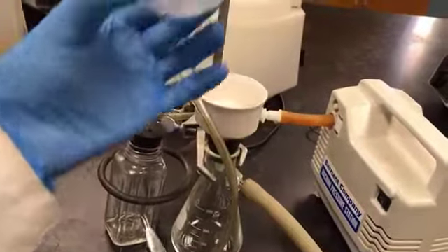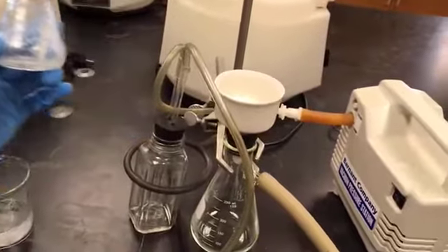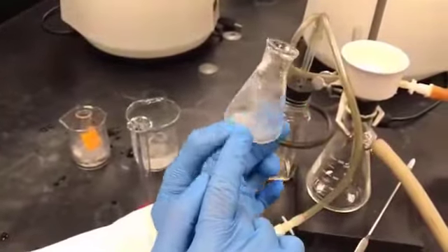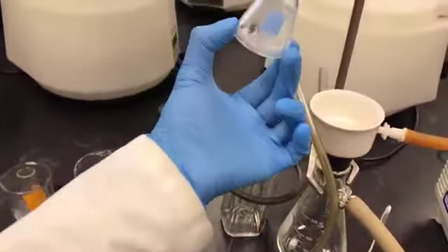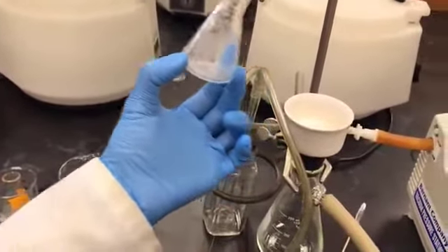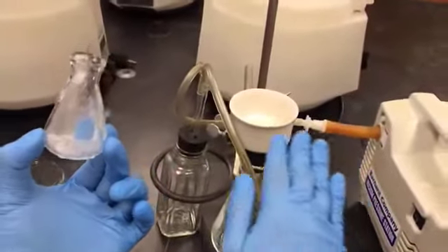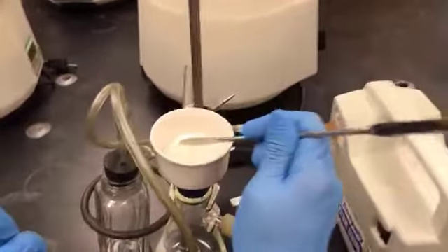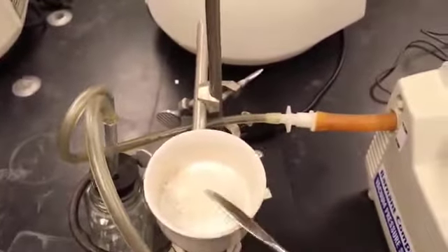Now you can see the crystals are still here, right? So what I will do is take 2 milliliters of the chilled ethanol into the measuring cylinder. I will add that chilled ethanol into this Erlenmeyer flask. I will slowly swirl it and try to transfer all the crystals. This way I transfer the crystals, and at the same time I give a wash to the crystallized product. Whatever impurities are associated with it will be dissolved and go to the filtrate. So it serves both purposes.